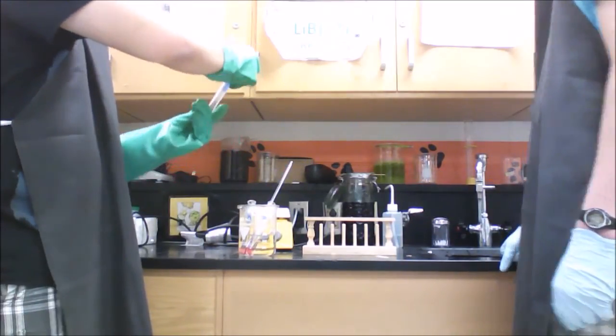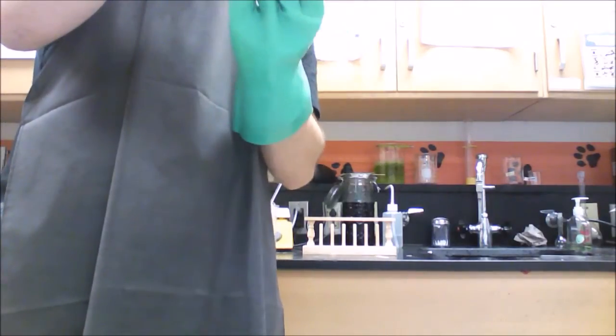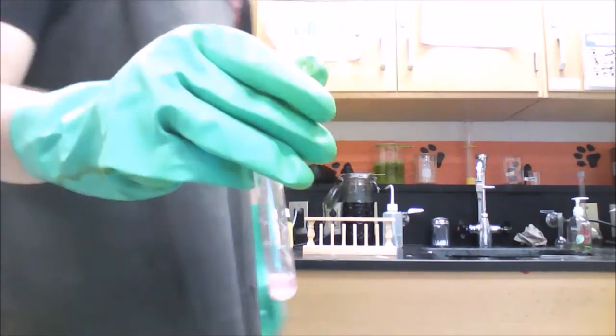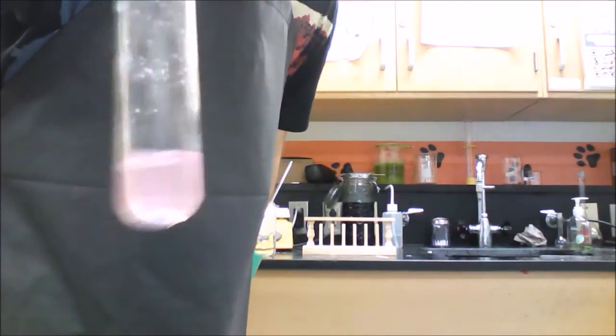So here, the silver nitrate, a lot of the silver has come down into particles, and you can see the white particles floating around. So it's actually a pink. It shows up much brighter on this camera, but particles are floating around in there, and it's a light pink.